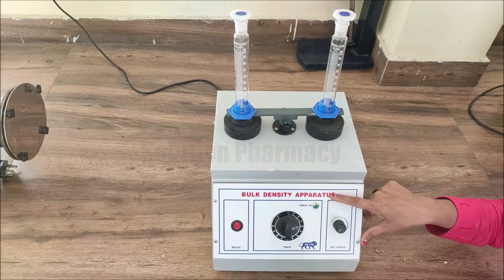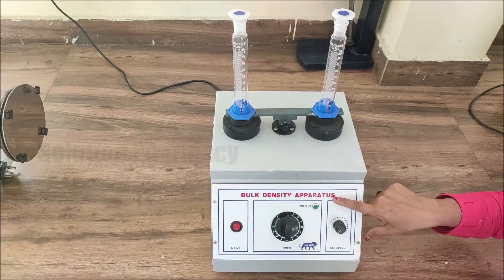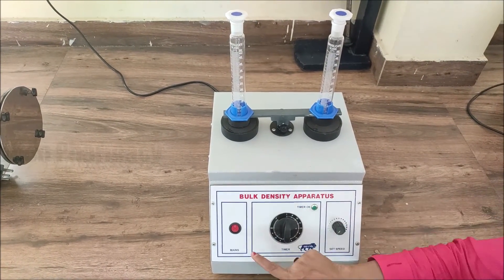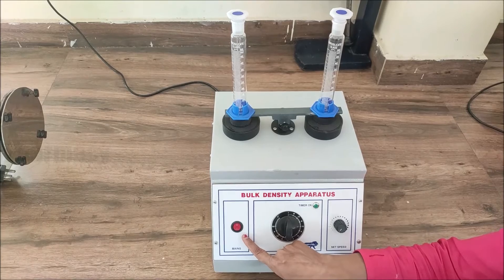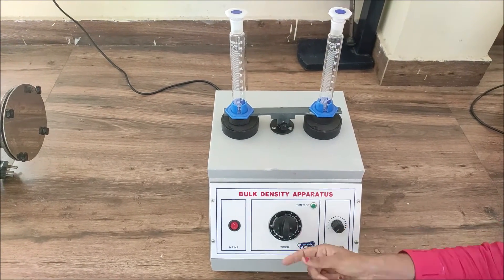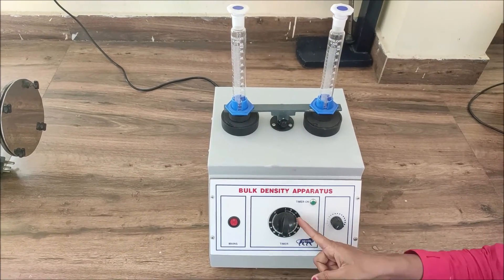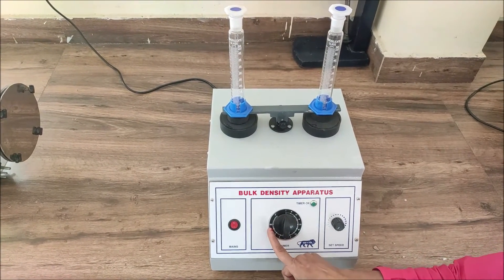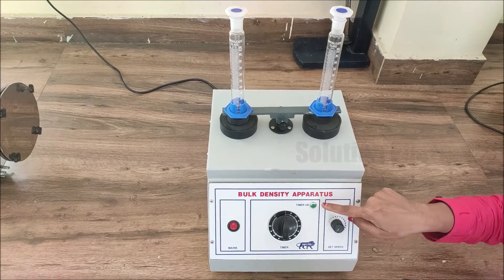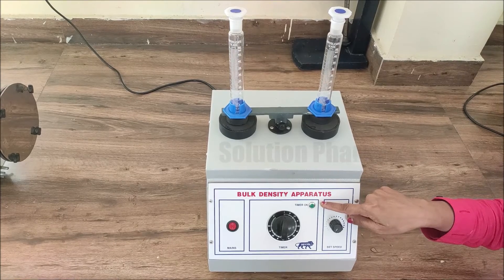First, let's know the different parts of the bulk density apparatus. This apparatus is the bulk density apparatus and this button is the on/off button. Next to the on/off button is the timer, and to set the time we rotate this knob according to our requirement — the number of tappings and time of tapping. When we set the time, this green indicator will turn on.